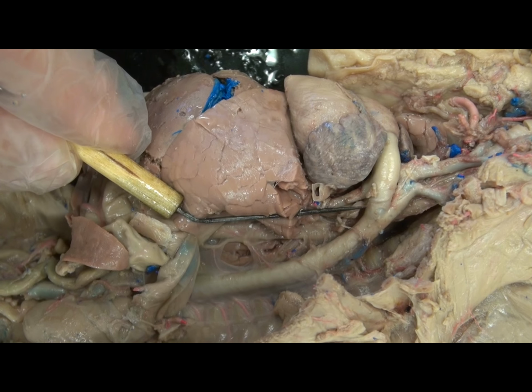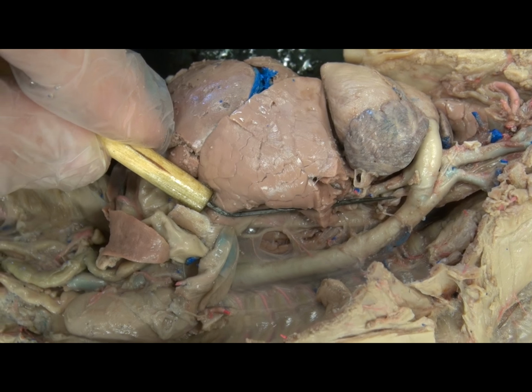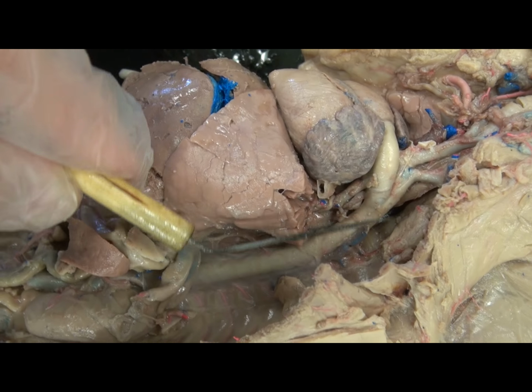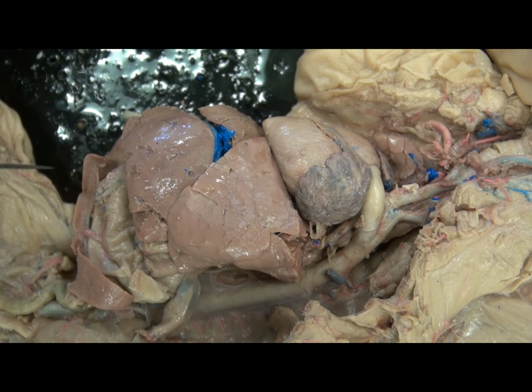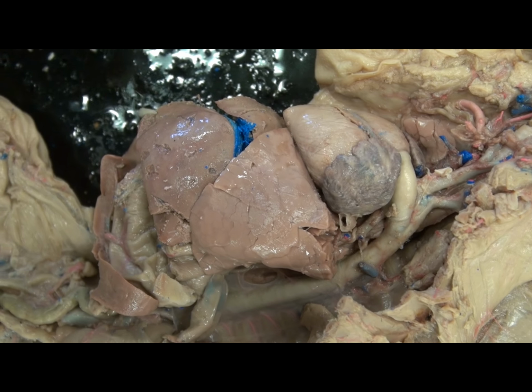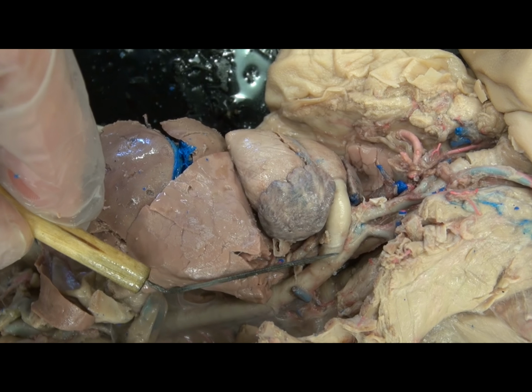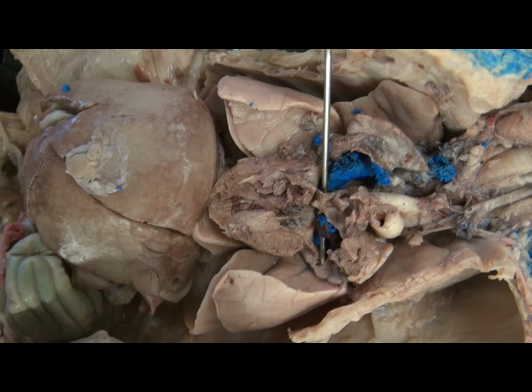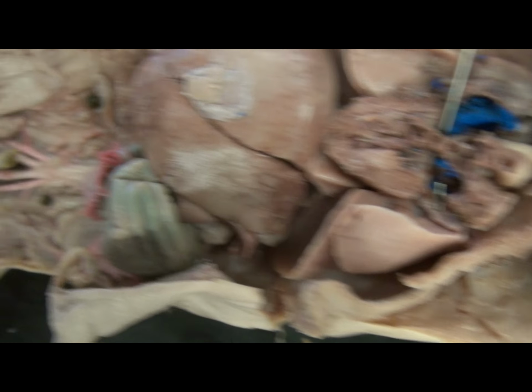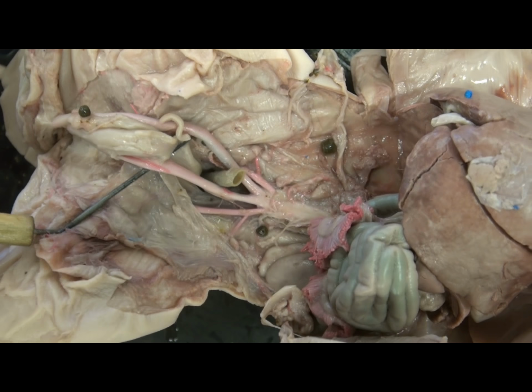But in the fetus, blood is shunted away from the lungs, given that they are not performing gas exchange and are filled with amniotic fluid, and thus is shunted to the descending aorta instead. So fetal circulation is different from adult circulation, as one can see with the ductus arteriosus, which does not exist in the adult, the foramen ovale, the opening connecting the two atria, which does not exist in the adult, the umbilical arteries, which leave the hip region.